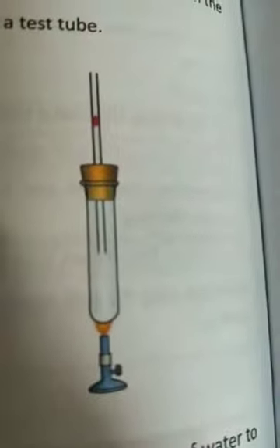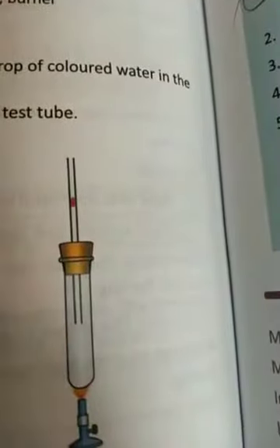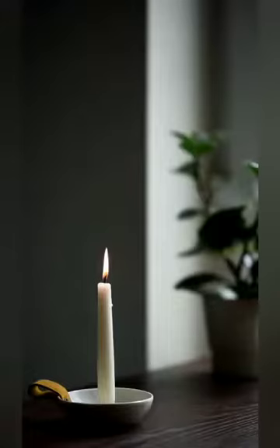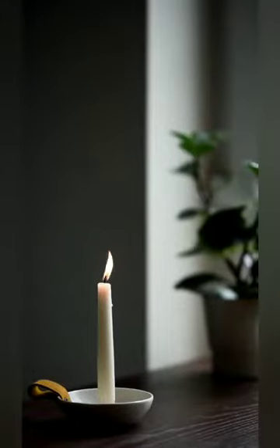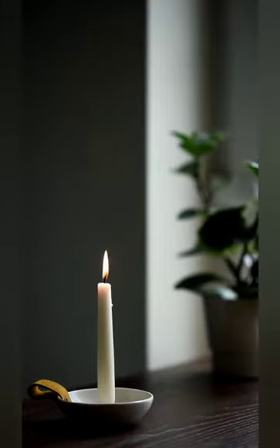When we cool the test tube again, the drop will come back down. This shows that gases also expand on heating.